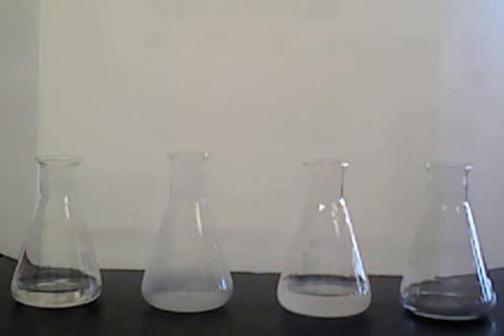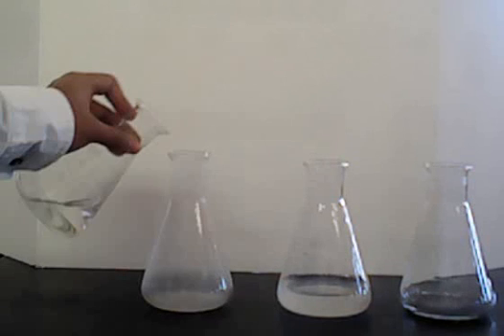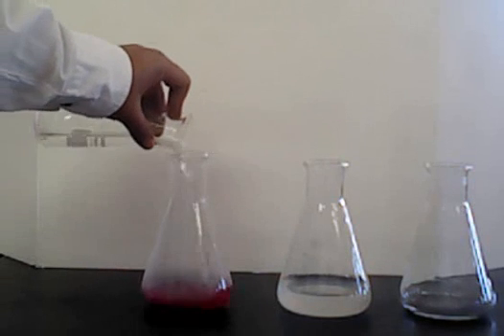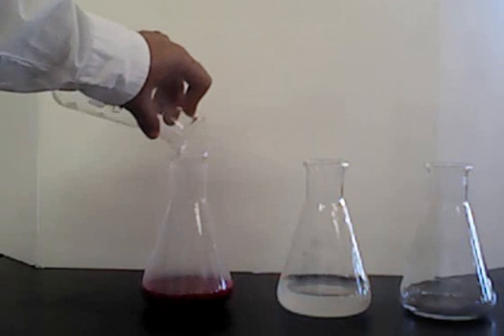a base. And if I throw it into the first liquid, we see that it turns red.